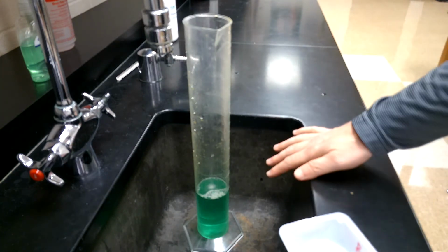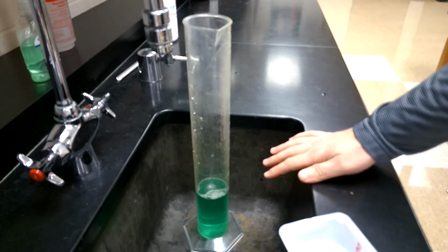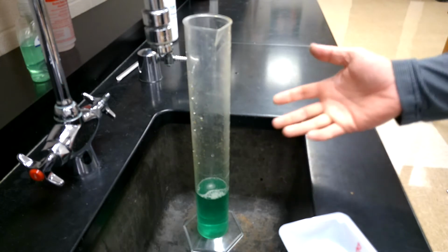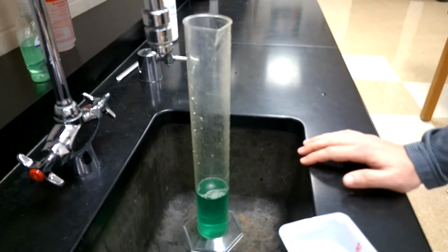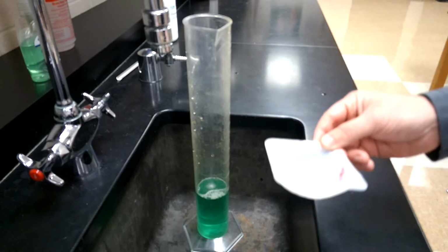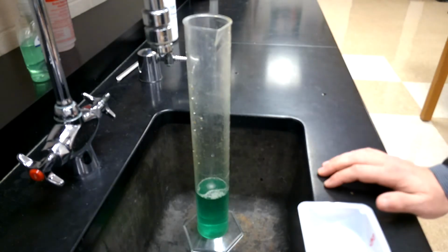What's happening in there right now actually is the hydrogen peroxide, which we use for cuts, is breaking down. It is bubbling a little bit into a gas and water. But this catalyst will make that happen much faster. So that's the first thing that we can do to speed it up.